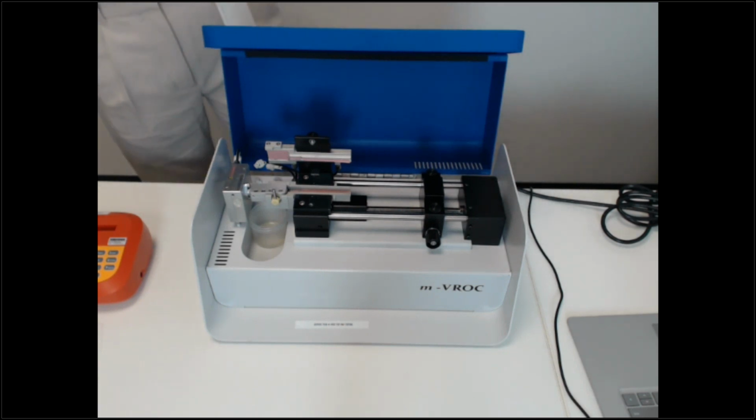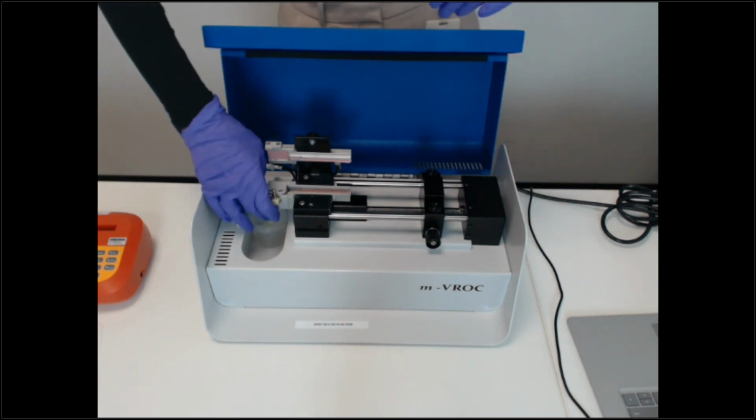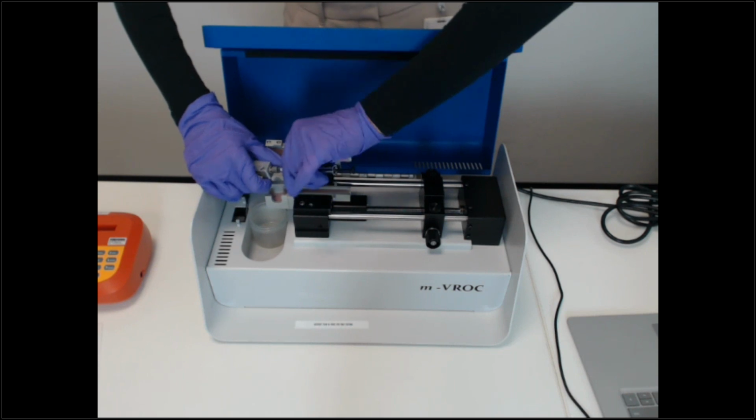50 to 60 microliters. And something about the VROC, unlike the VROC II and the Microvis, is you are going to have to type in the amount of volume you have. Both our other instruments will automatically find the end of the syringe and let you know how much is in there. So sometimes it can be tricky to try to figure out the exact amount you have.